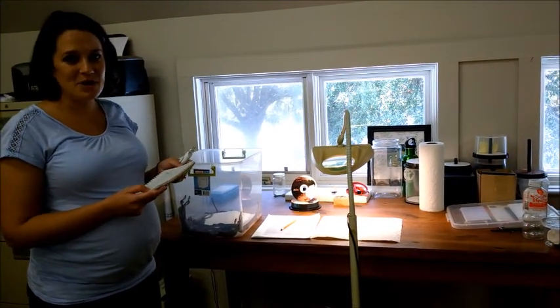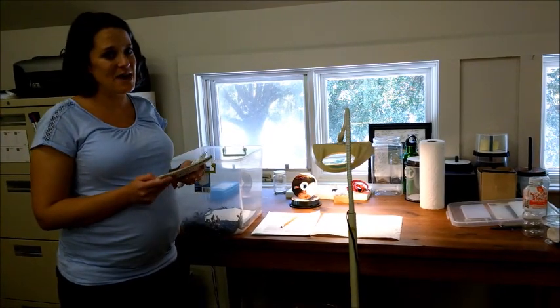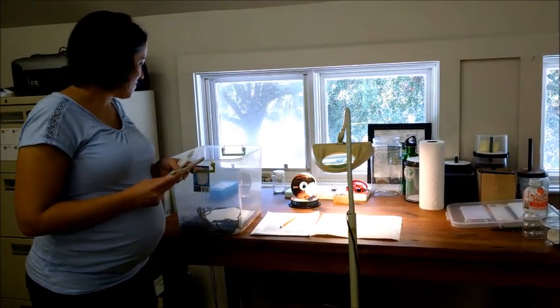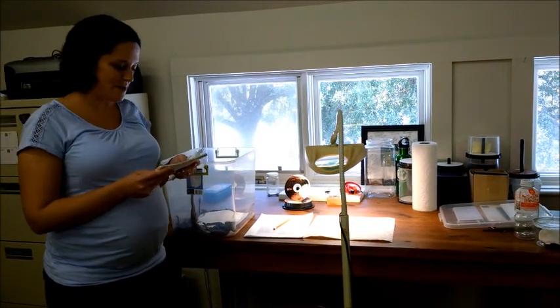And now I'm going to help him mark these babies so that when we release them back into the habitat that their eggs would have come from, we can find them again hopefully in the future and know that they're from this year's babies.